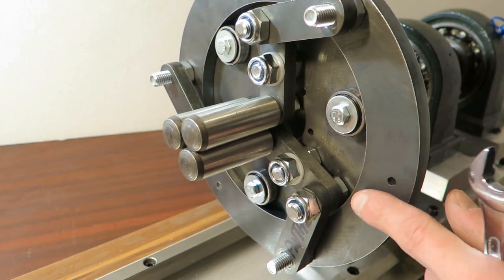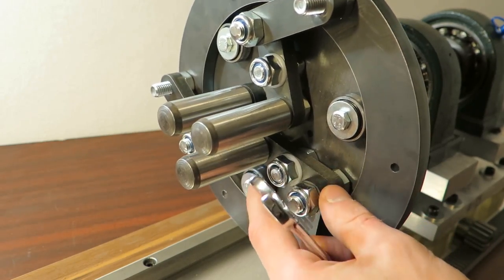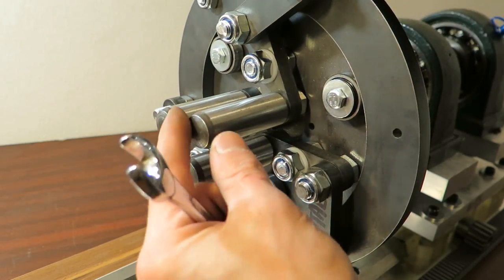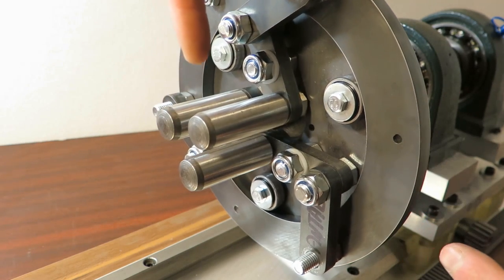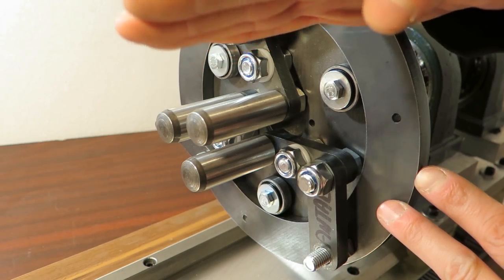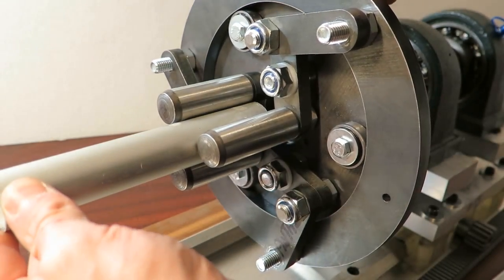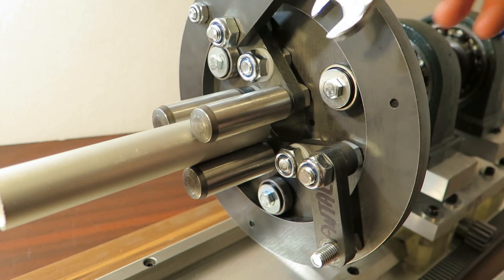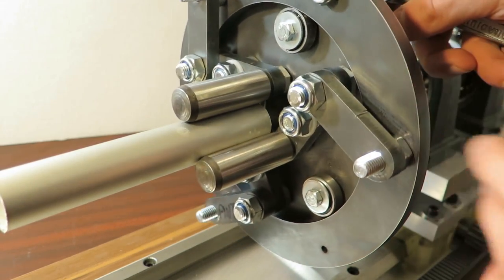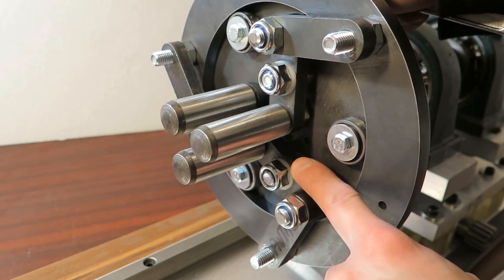Also, since we are not using ground pins, especially at this point, because this is defining basically the position of this thing. You can see that I can move it, maybe you can see it, but it can move basically in this direction, towards and off from the center, and that's okay. The problem would be if this will move basically in angle to the base plate. Well, that would mean that you will hold this tube and this side will be fixed and there will be quite a lot of play. To eliminate that, you will have to tighten this bolt, or you will have to tighten this nut quite a lot. I mean quite a lot. It has to be free to move, or to allow movement of this part there, but it has to keep it flat.